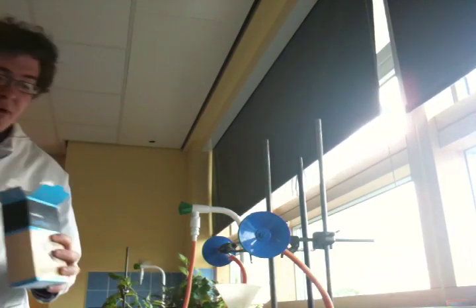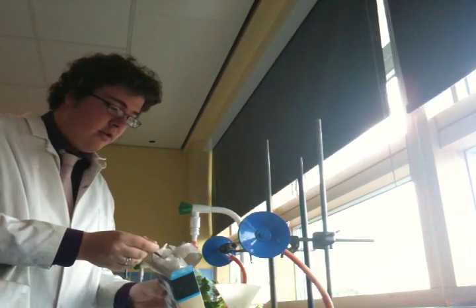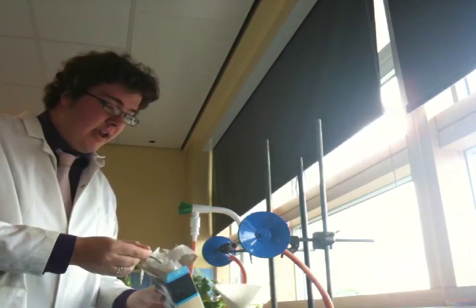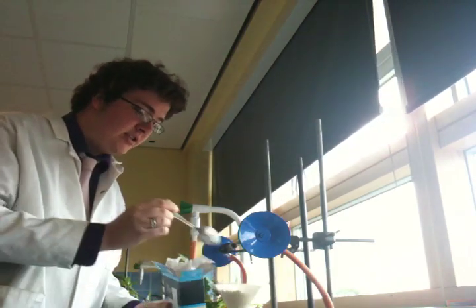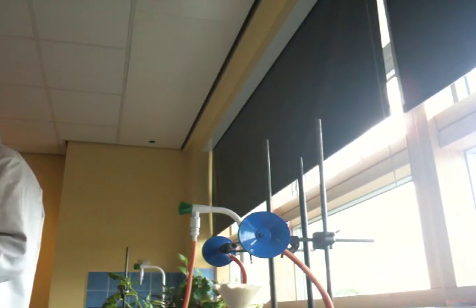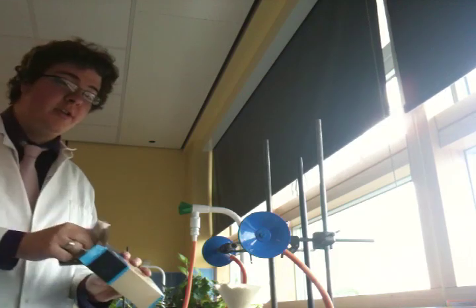Right guys, so what I'm doing is I'm putting our cornflour into this funnel. Now, in a moment, what I'm going to do is light the two Bunsens above. So we're still providing our heat energy, so we're still heating up the reaction that we're doing, but also we're doing something else.